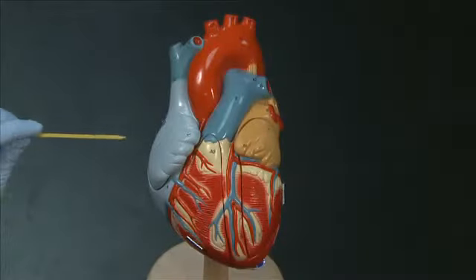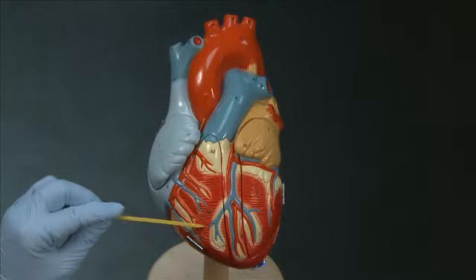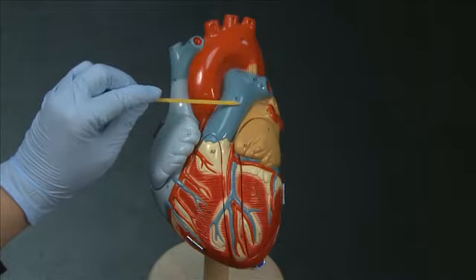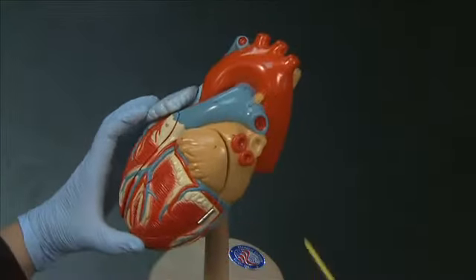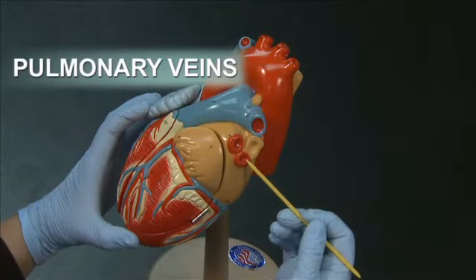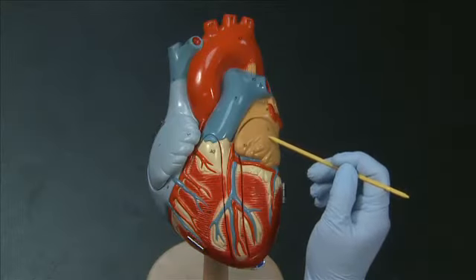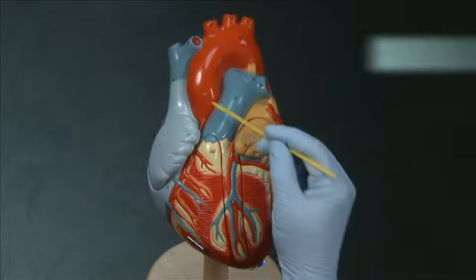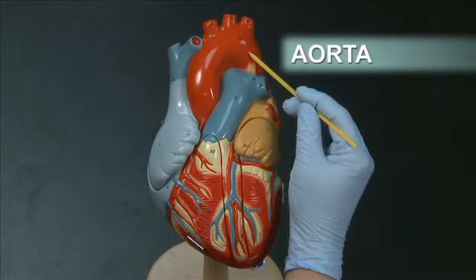From here, the blood flows from the right atrium to the right ventricle and out the pulmonary trunk to the lungs. From the lungs, the blood returns to the heart through the pulmonary veins, which you can see here entering the left atrium. From the left atrium, blood flows into the left ventricle and then out the aorta, which is a large vessel that you can see just posterior to the pulmonary trunk.